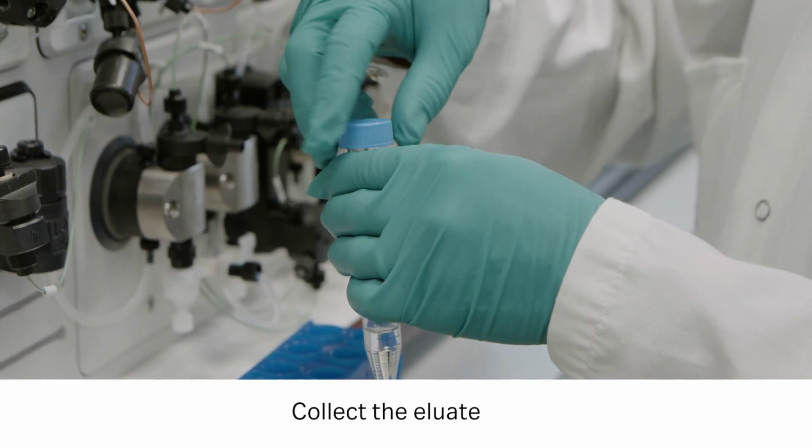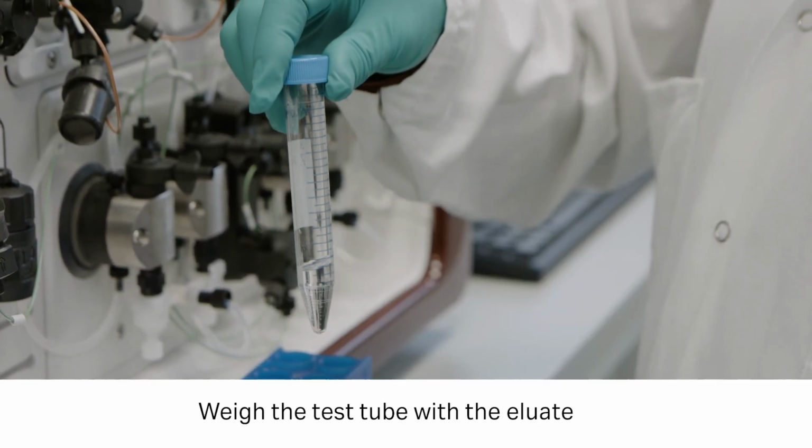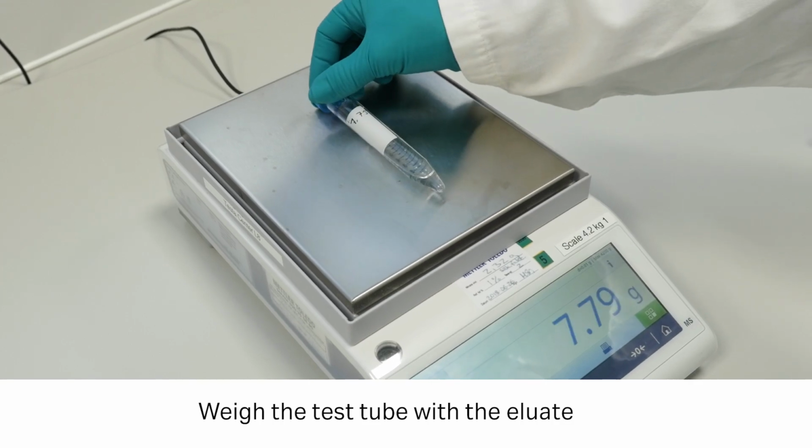Collect the eluate. Weigh the test tube with the eluate to determine the exact volume.